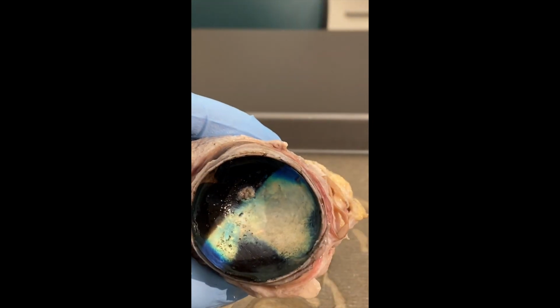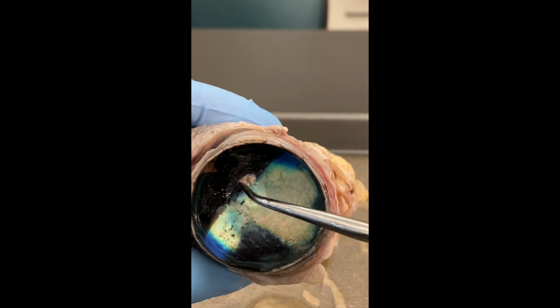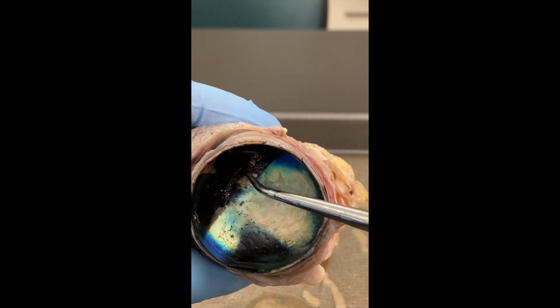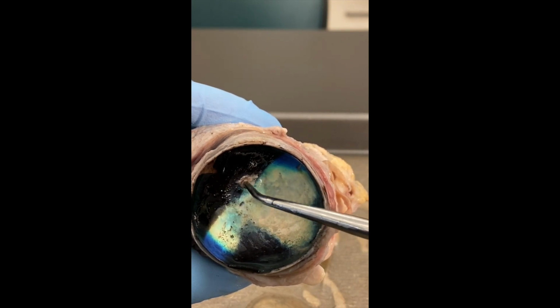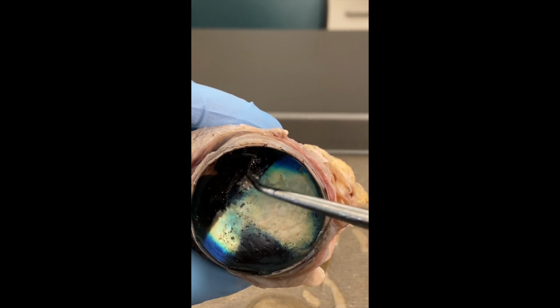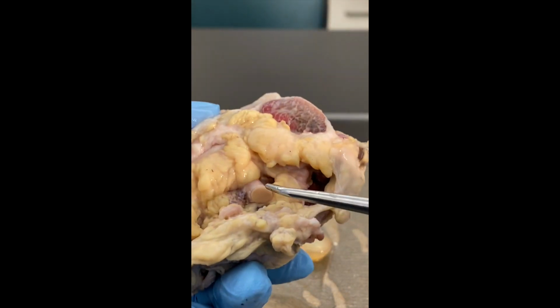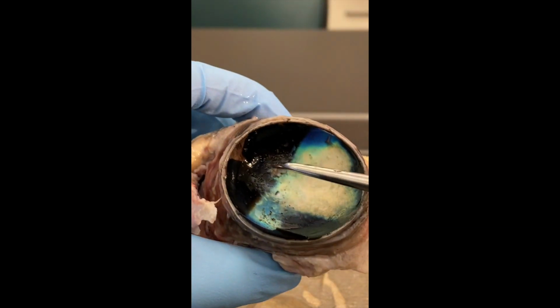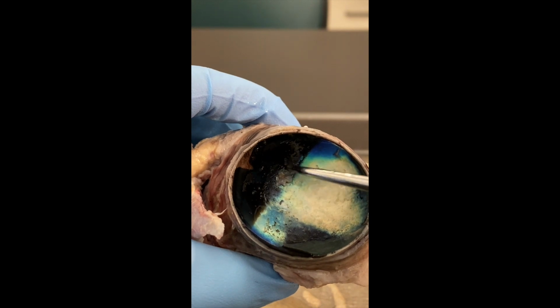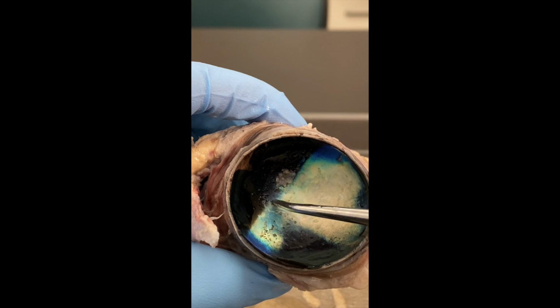All right, so this little thing right here that kind of looks like a spit wad or a wet booger, whichever you prefer, that marks where the optic disc is at. The optic disc is where the retina attaches, but it's also the starting point for what we saw as the optic nerve, which is back here. So the optic disc, blind spot, where the retina attaches, is also where the optic nerve begins.